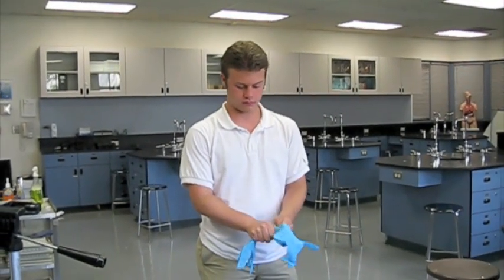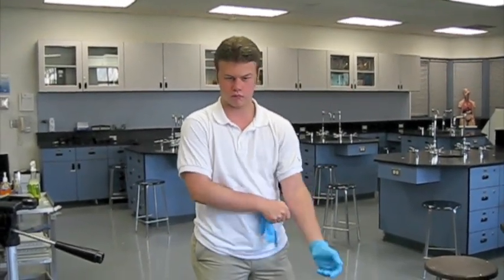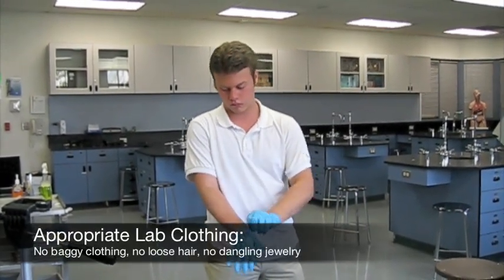But before we start any dissecting, let's go through some important safety information. First, remember what we're working with — real world specimens which have been treated with a variety of chemicals. In addition to these chemicals, some natural body fluids are still present inside, so you may want to make sure to take off any baggy clothing and tie back any loose hair.